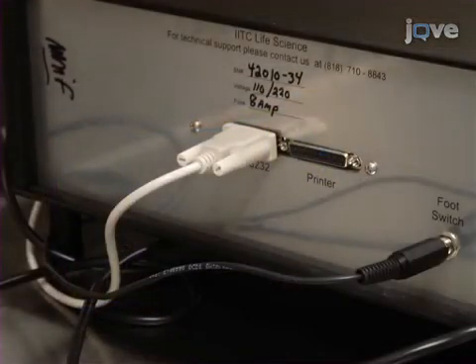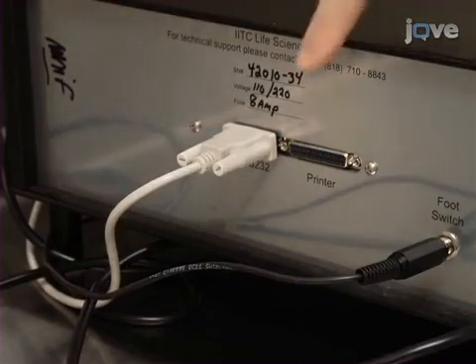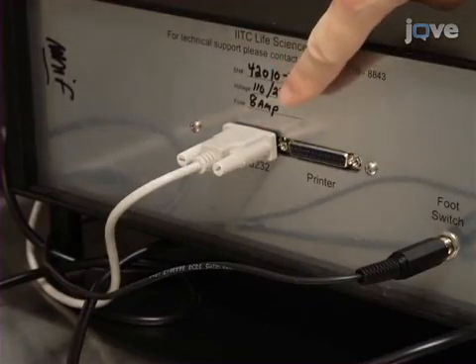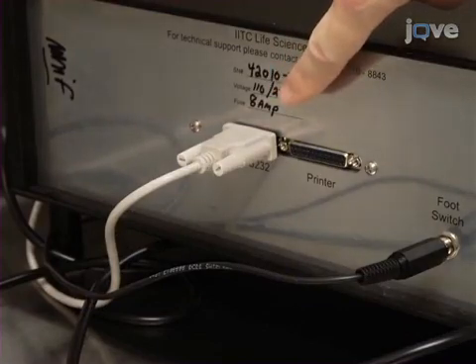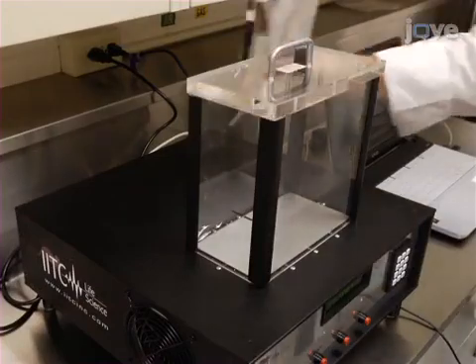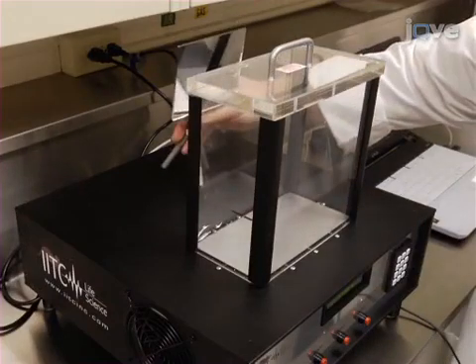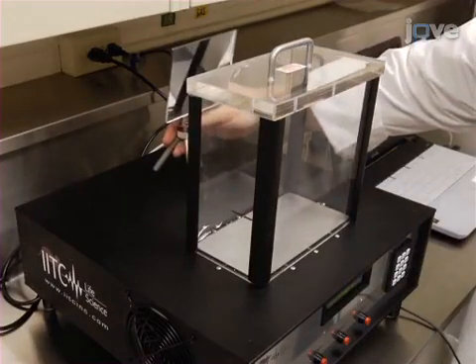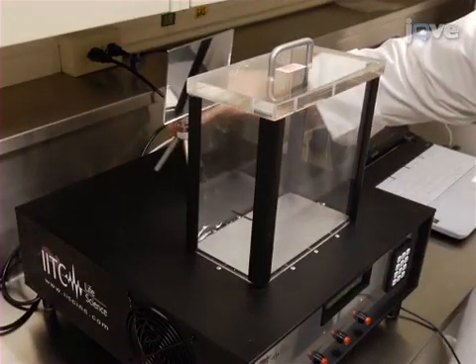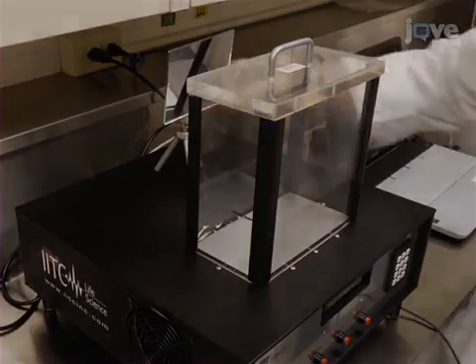Alternatively, hard copies can be printed using a serial port located on the unit. Place a mirror behind the plexiglass chamber to increase the visibility of the animal's behaviour.